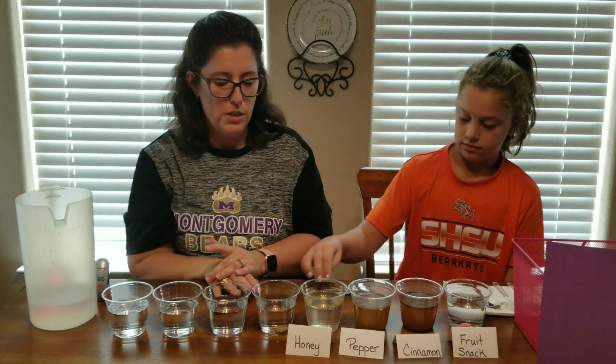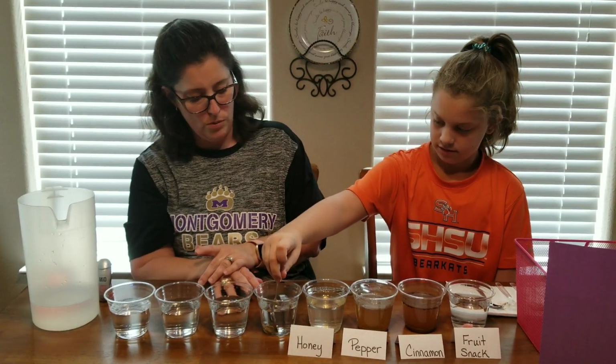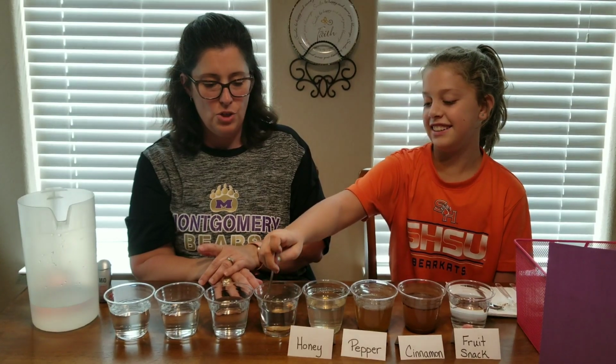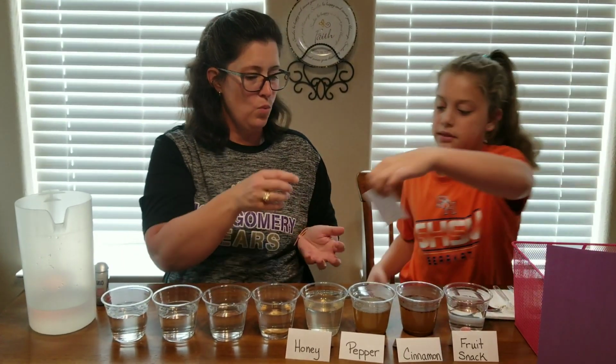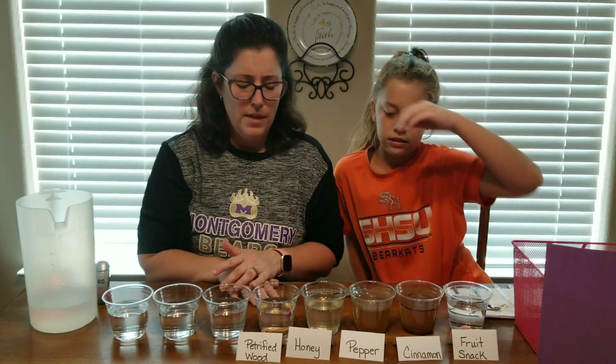And Carly can stir just a little bit if she wants. What's that one? Oh no, new spoon. I got plenty of spoons. We got 3 left and 3 more samples. All right, she stirred it up a little bit. And we're going to label it. Petrified wood. Very nice. Hopefully y'all can see the labels.